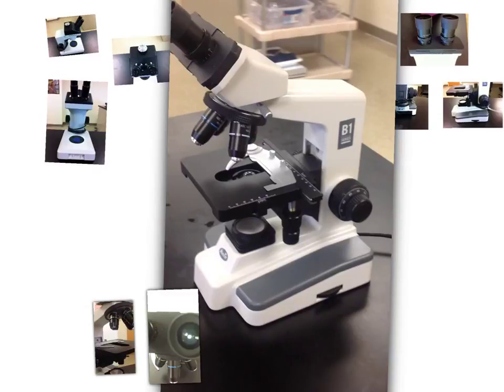And then on this side, if you guys take a look, here we have our two adjustments. We have our coarse adjustment and our fine adjustment. Our coarse adjustment is only going to be used under the lowest magnification and then sometimes on the middle magnification. Once you get into higher magnification, you're only going to use your fine adjustment.